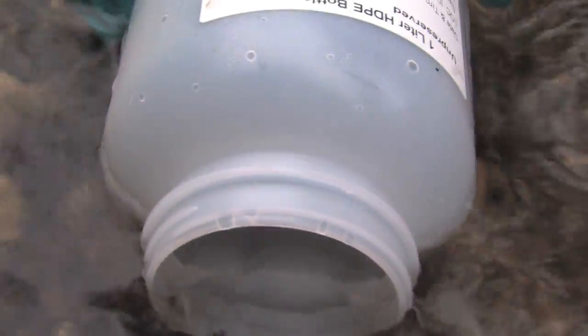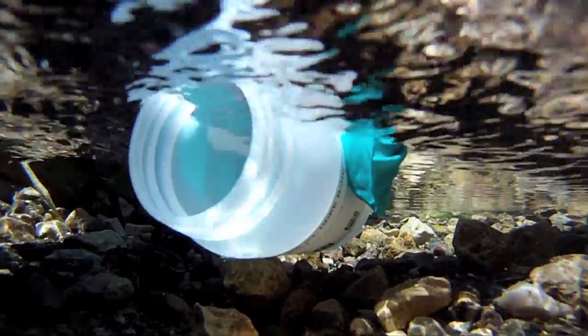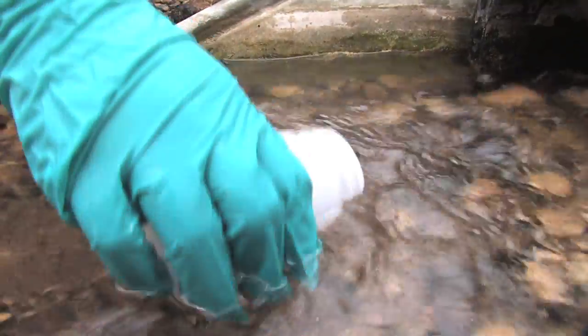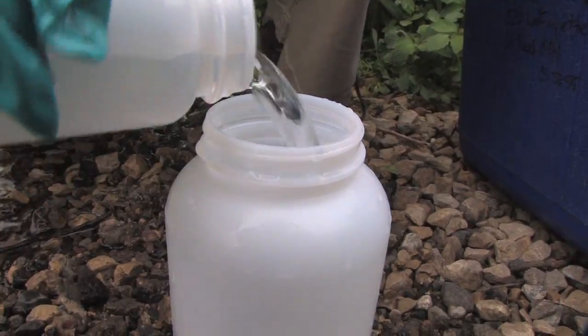Hold the bottle so the opening is facing upstream. Take care not to disturb the bottom of the stormwater flow, and don't walk in the discharge so that you won't contaminate your sample. The collection of the sample should be as close to the middle of the stormwater flow as possible to be representative of the discharge. You'll notice that I'm not placing my fingers or hands over the top or inside the bottle when collecting the sample, as otherwise I might contaminate it.